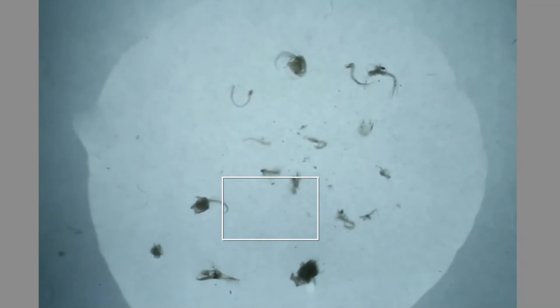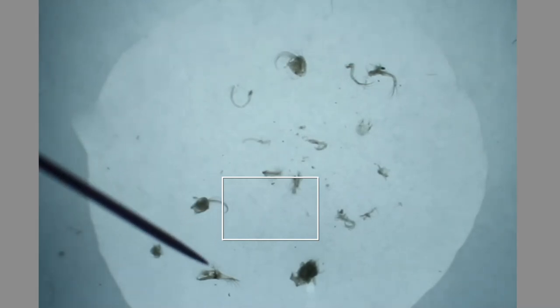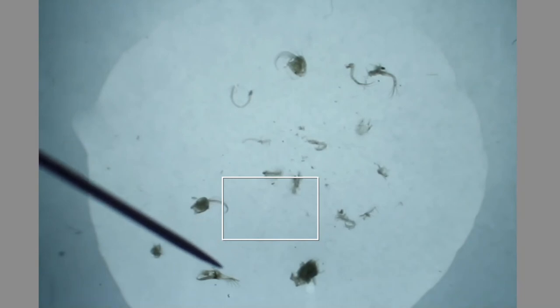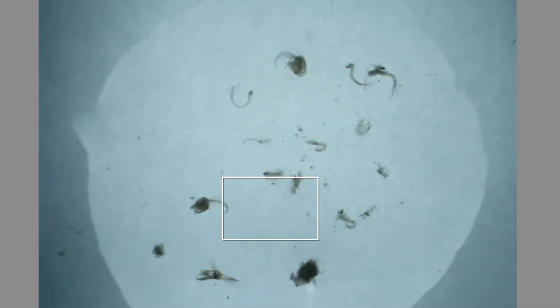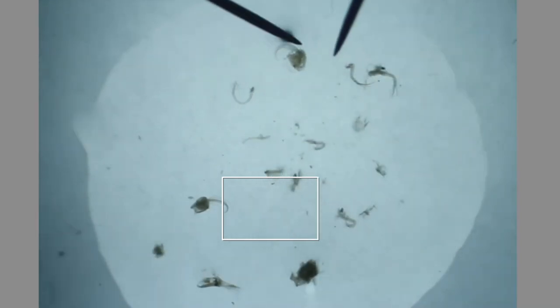This is my spacing in my big drop of glycerol before I put on the cover slip. Once I put on the cover slip, it's all ready to start taking photographs. When you're putting these down, try to make sure that everything is already at more or less the angle that you're going to want to photograph it at — that's just going to help you later so you don't have stuff at weird angles. You can flip stuff around right now, and it's harder to do it later if you want a better view.